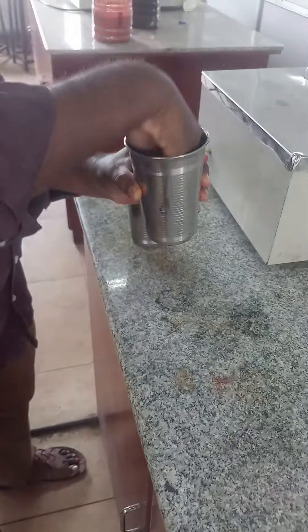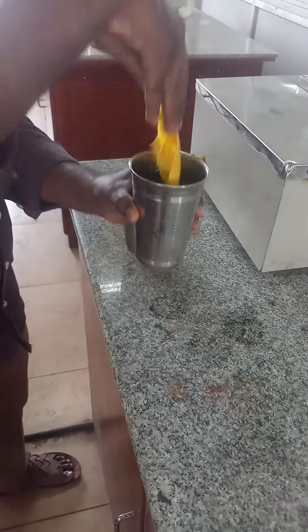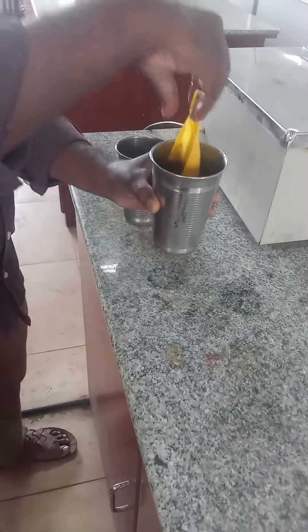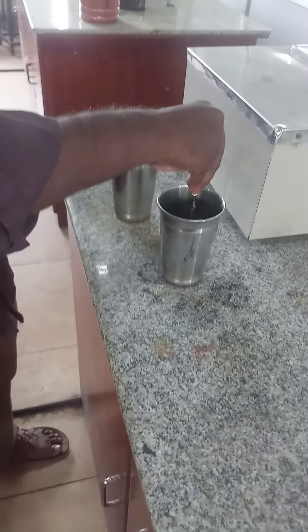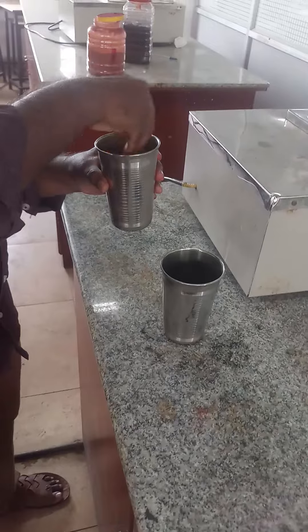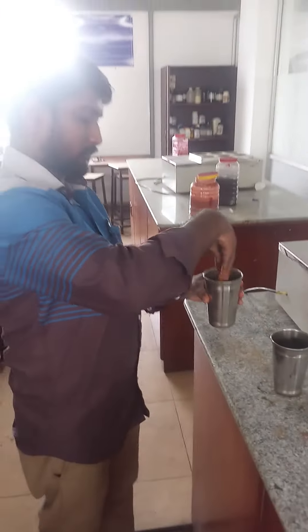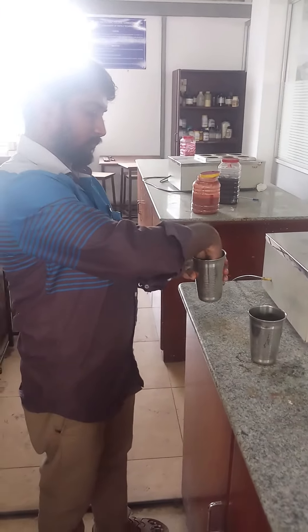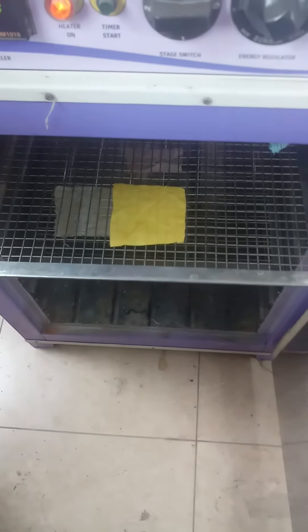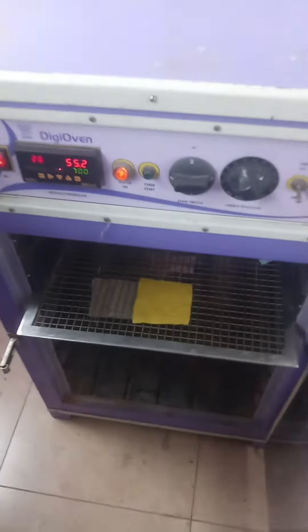After dyeing, the dyed polyester fabric has been subjected to washing with soap water and then washed with cold water. The polyester fabric has then been subjected to drying in the hot air dry oven.